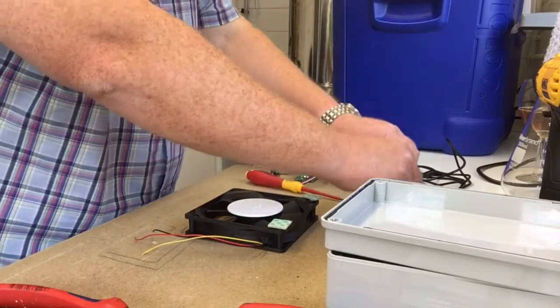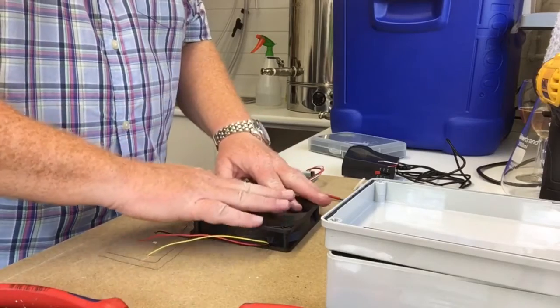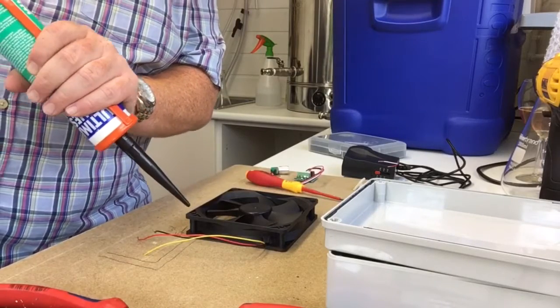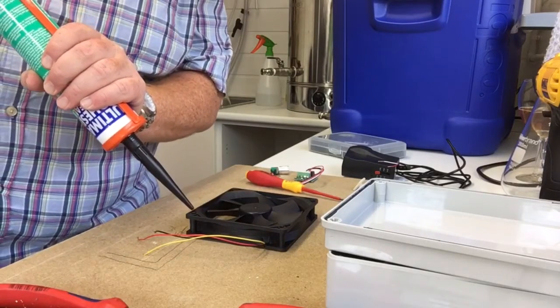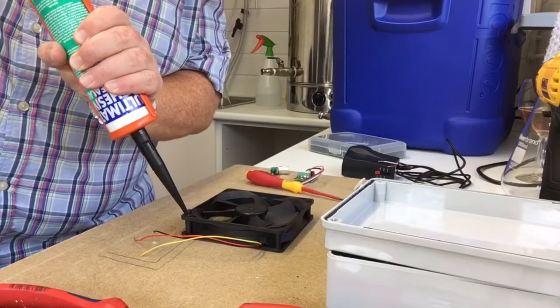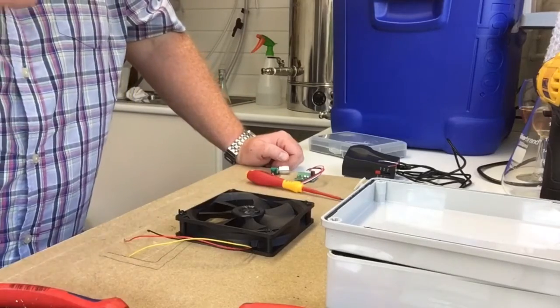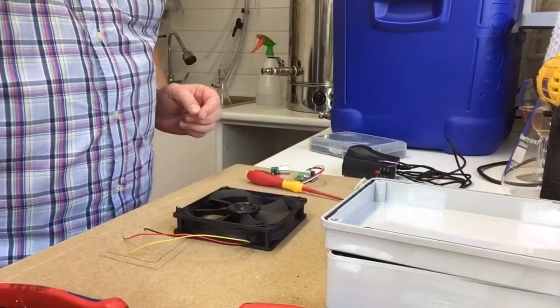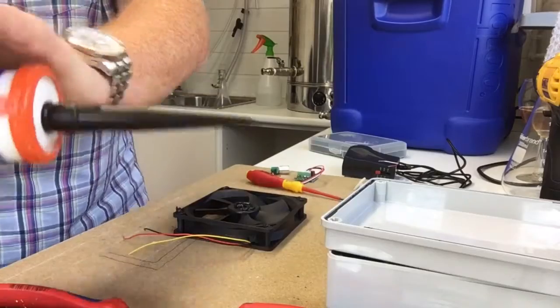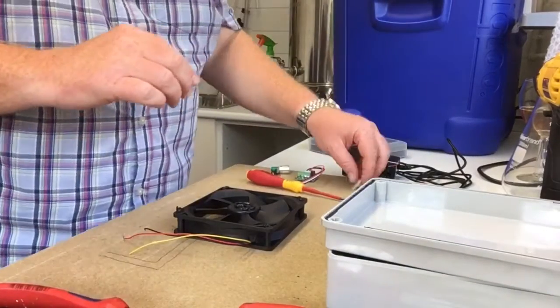So job one is to mount all these. So relatively straightforward, he says. Right. Well, sorry about that, my phone went. So let's stick a tiny little bit more of that on there, and off. Let's stick these doofers on.